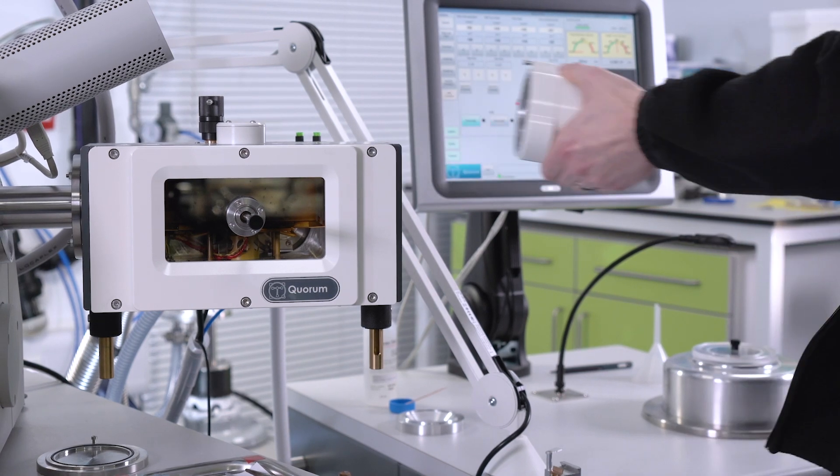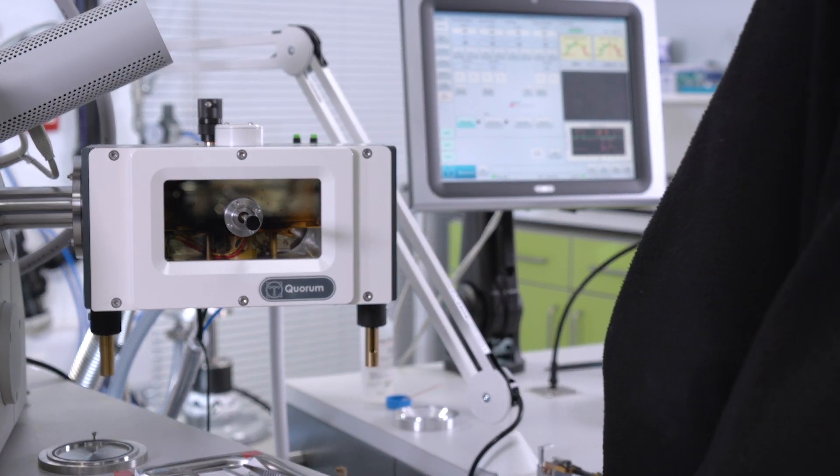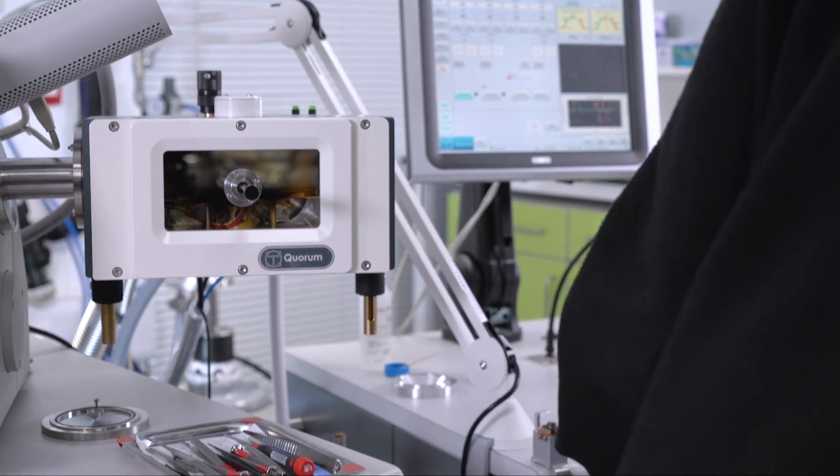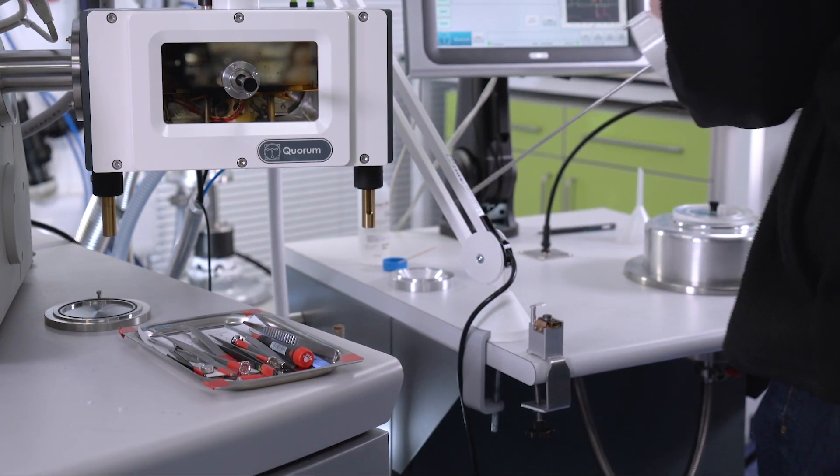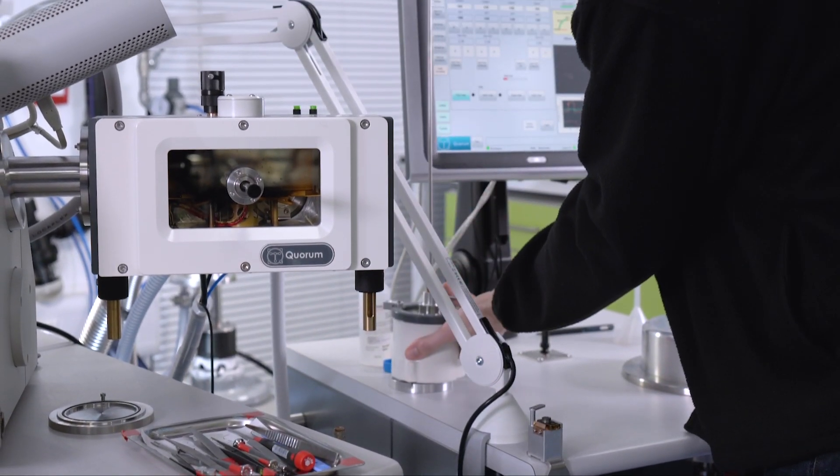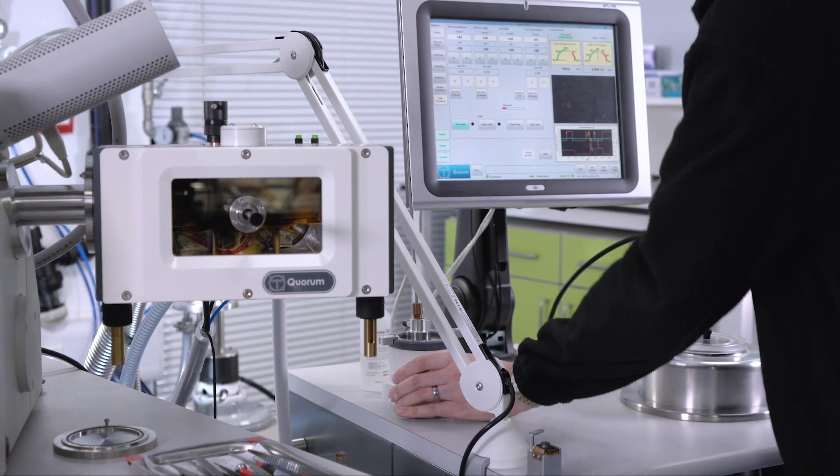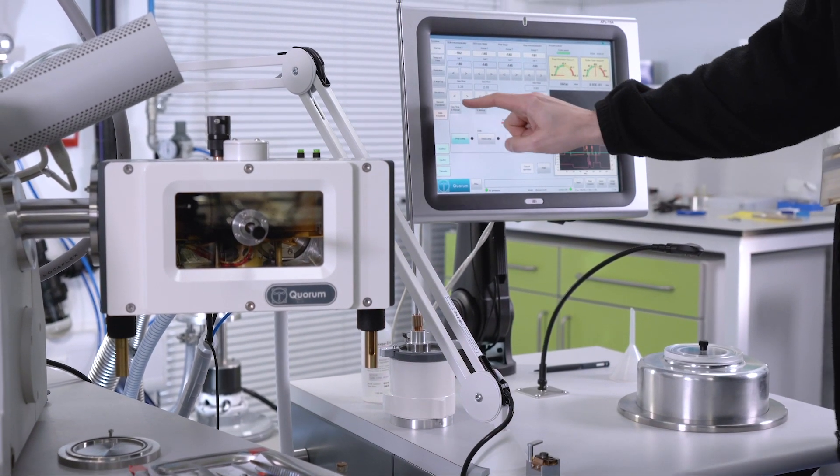When we come to the end of the day or the end of your session, then we'll take the sample out of the microscope and we will then put the specimen exchange into the storage. And then to shut the system itself down is very simple.